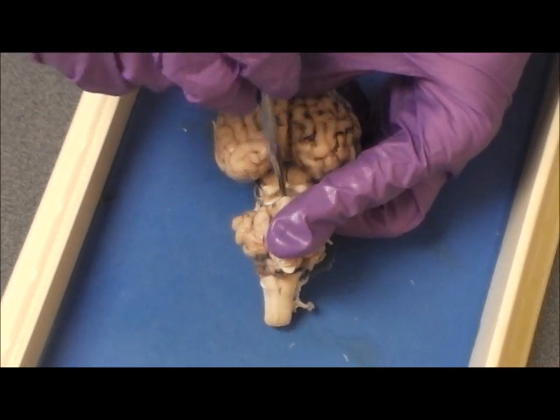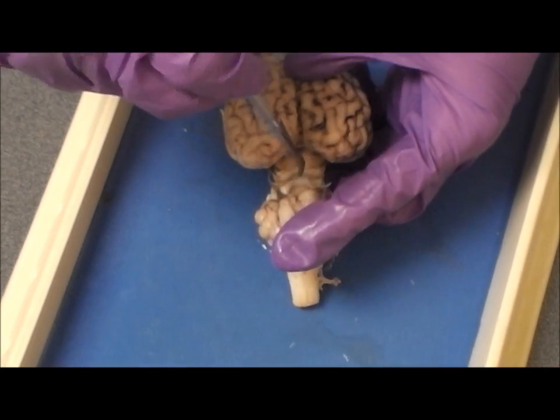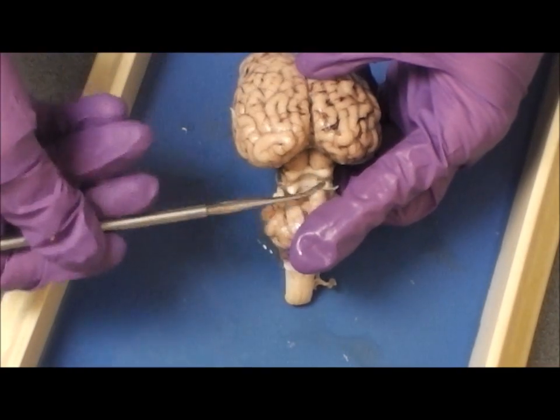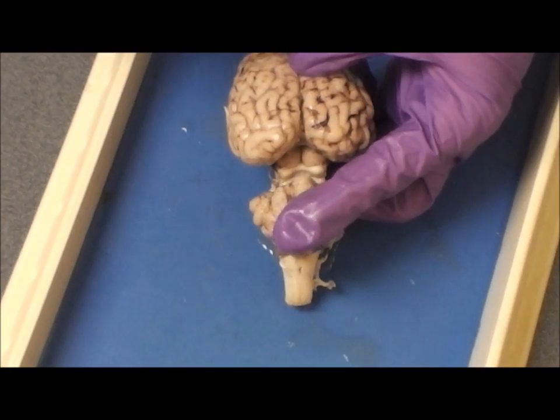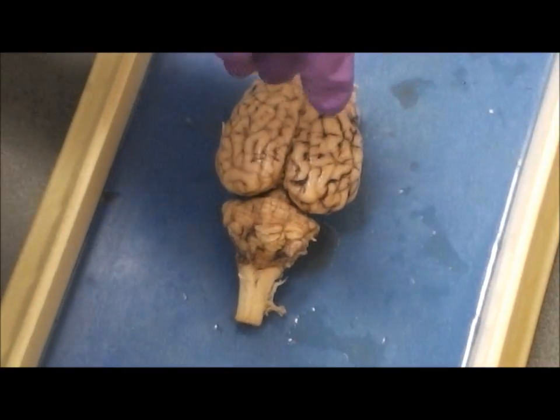Caudal to those, sneaking underneath and lying beneath the cerebellum, is the fourth ventricle. Thank you.